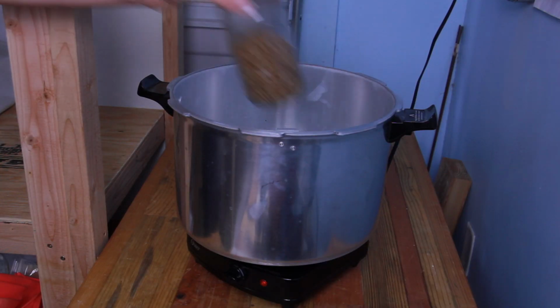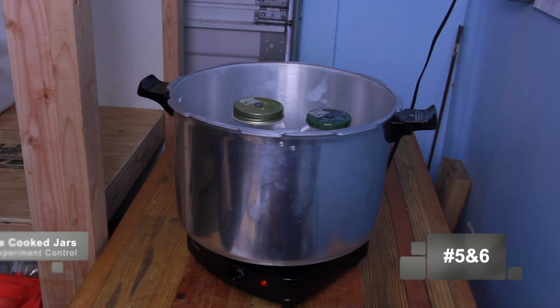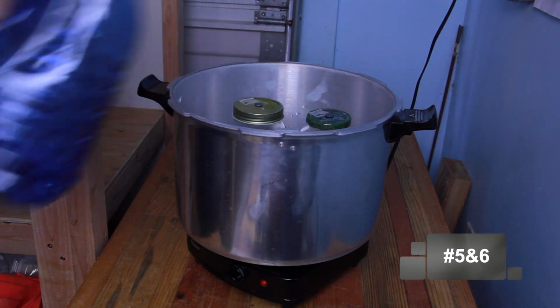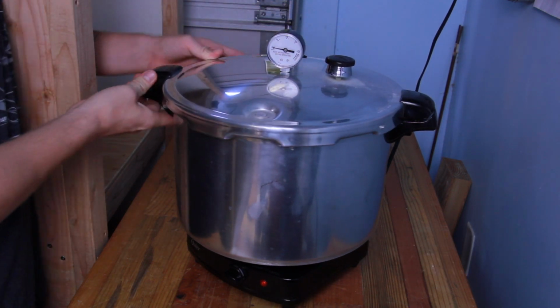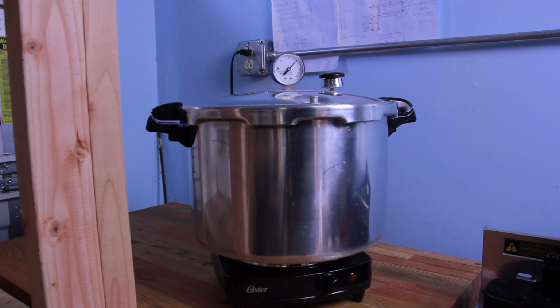For jars 5 and 6, I'm going to pressure cook these at 15 psi for 90 minutes. This is the standard procedure that I use any time I make grain spawn in the traditional fashion. Once the pressure cooker got up to 15 psi, I turned my heat source down a little bit so that it didn't vigorously boil, but maintained 15 psi.